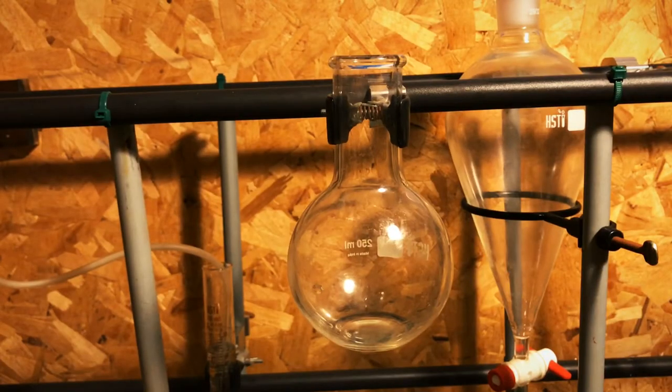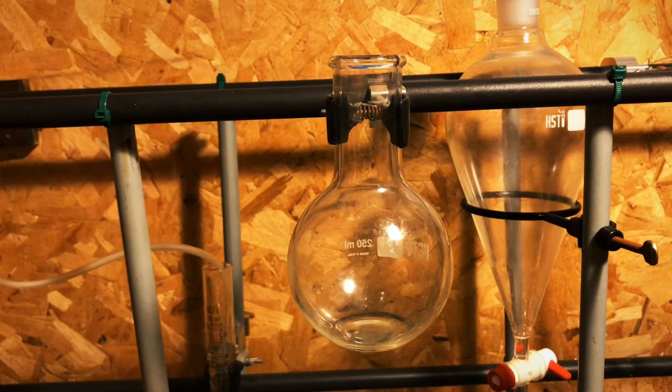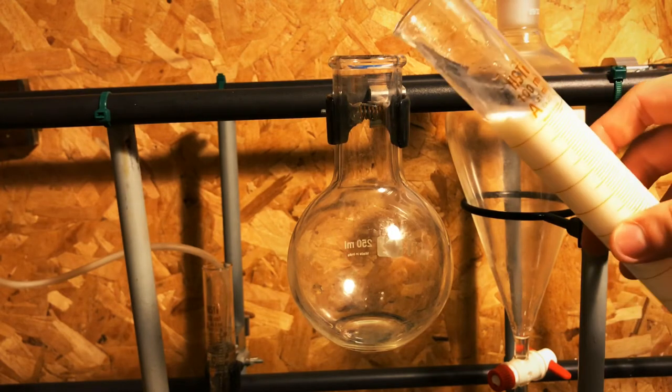To extract casein, one of the proteins found in milk, I'm first going to add 200 milliliters of whole milk to this round bottom flask.